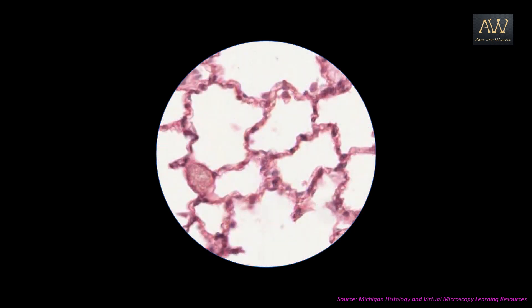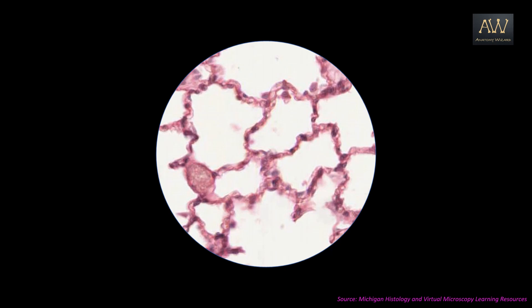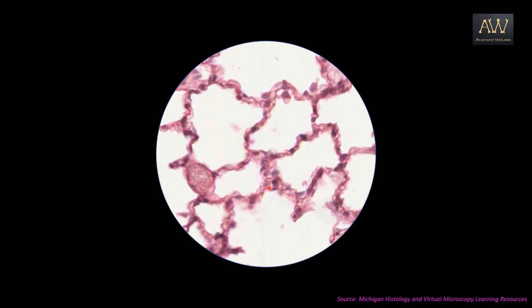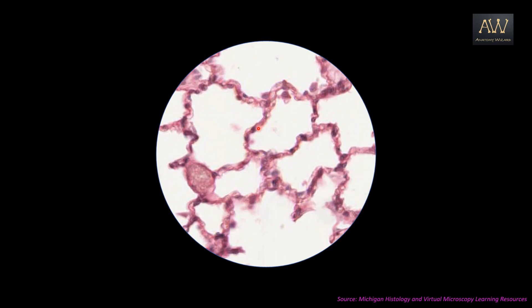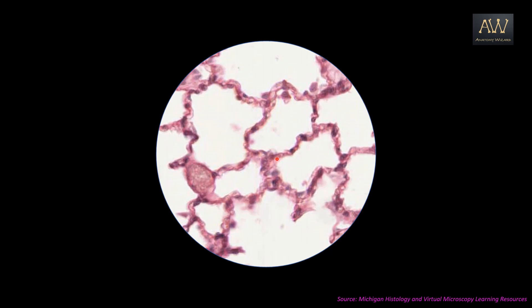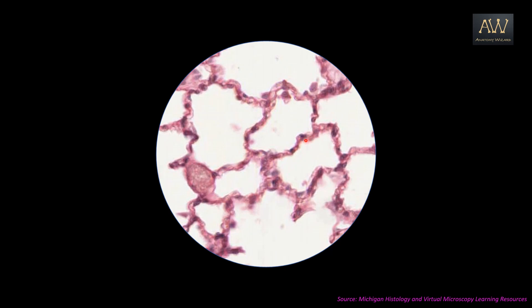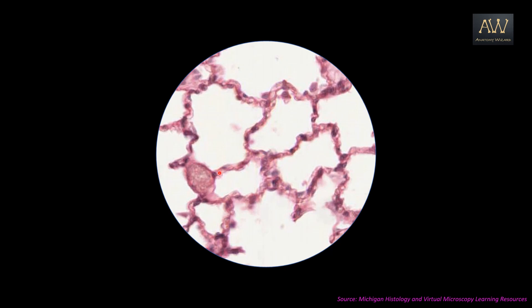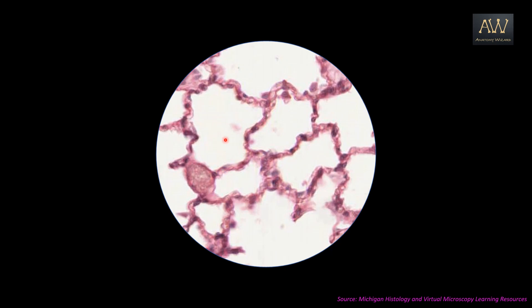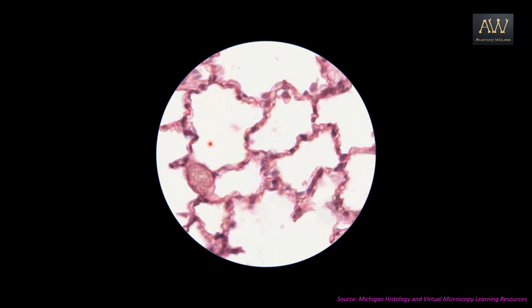On zooming in, we can see that these multiple free spaces are roughly in a honeycomb pattern and are separated by very thin layers of tissue. In fact, they appear as having only a single layer of cells. We can make out that these darkly stained nuclei are actually flattened, which is typical of squamous epithelia. So this slide is the typical appearance of a section of lung, and these free spaces are actually the alveoli, which are separated by layers of squamous epithelial tissue.